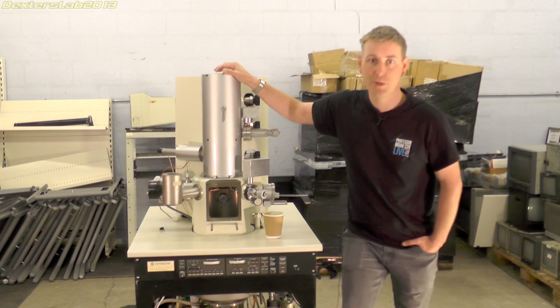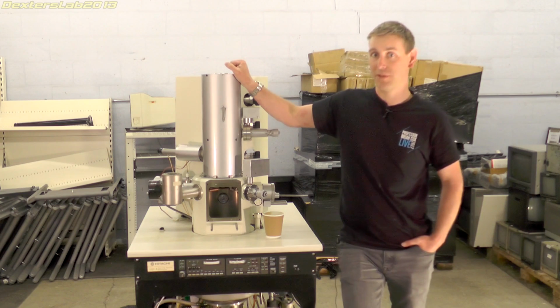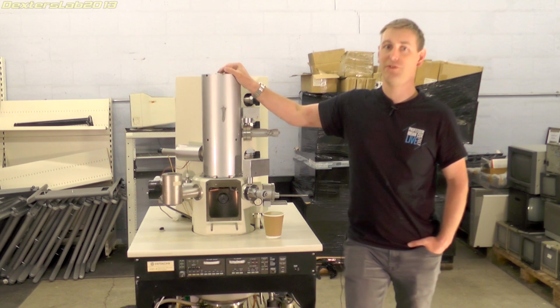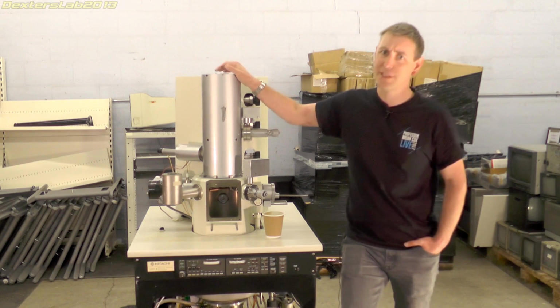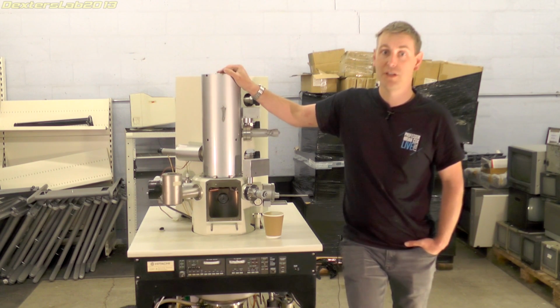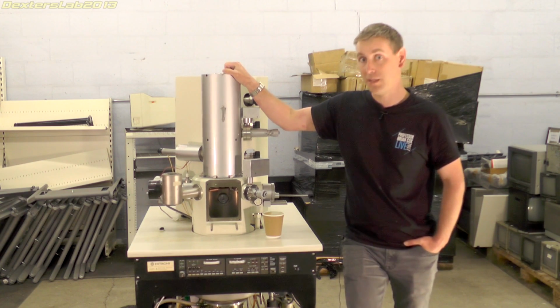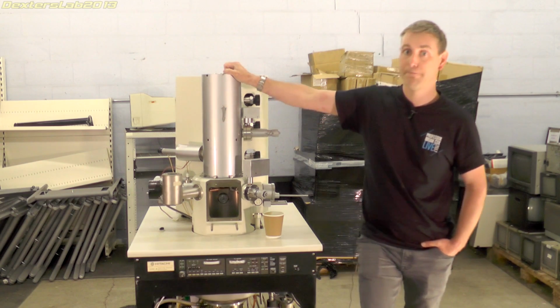Things like this get scrapped all of the time, so don't beat me up for scrapping this bit of beautiful science. It's completely non-functional, but with a bit of careful disassembly, we can save parts that are in this for others to use rather than just sending the whole lot to the scrap metal pile, which is where it would have ended up if I hadn't bought it.